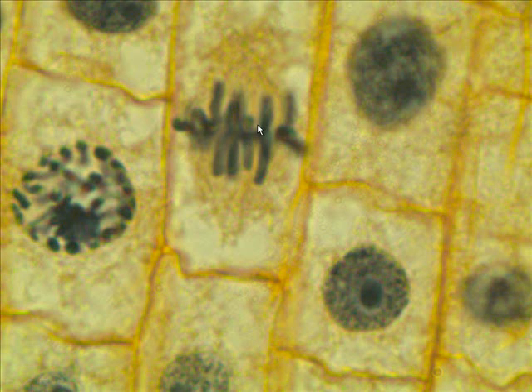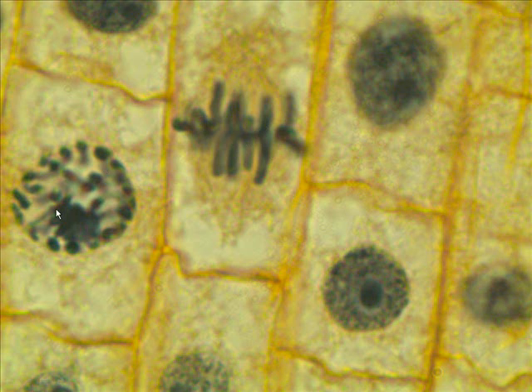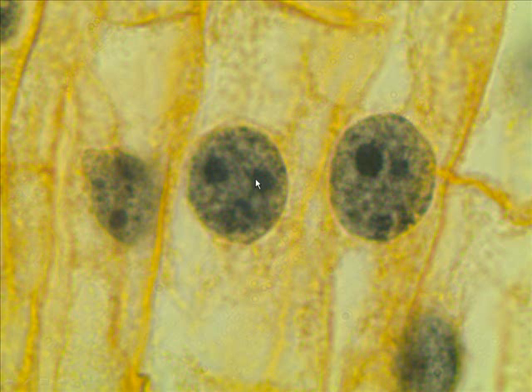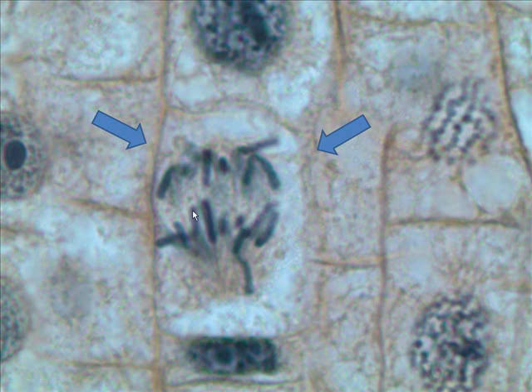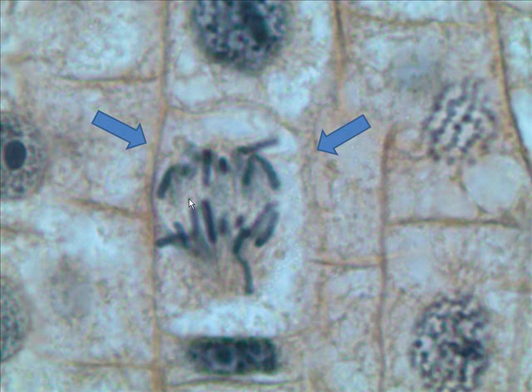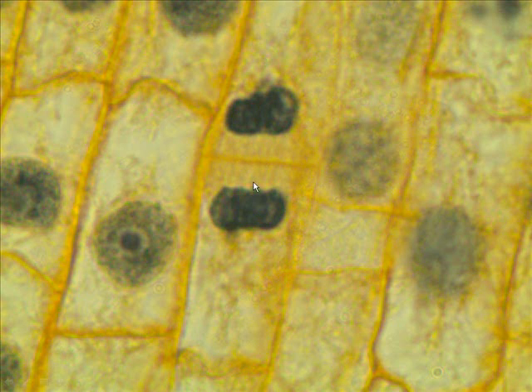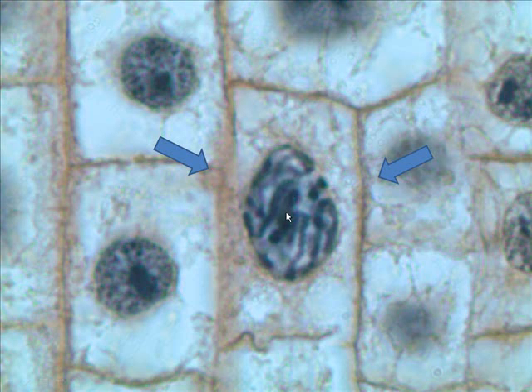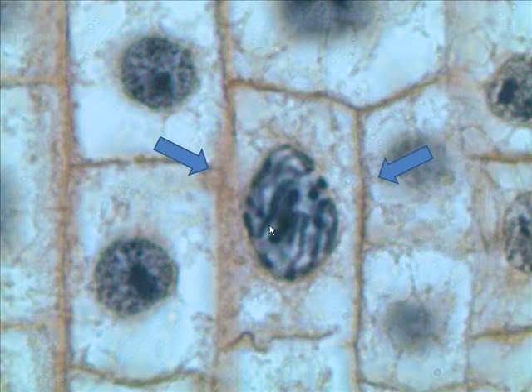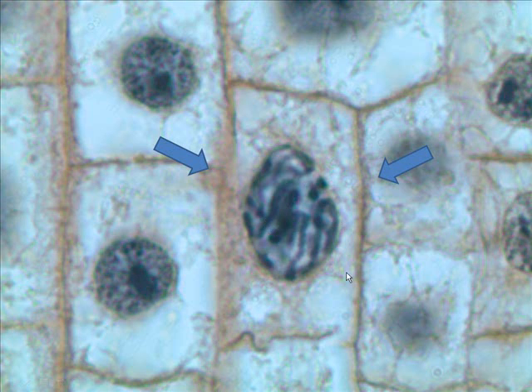And what's this? Metaphase. This one over here? Prophase. There you go. One of these two? Interphase. Anaphase. Telophase. And prophase. And that's it, ladies and gentlemen — you got it.